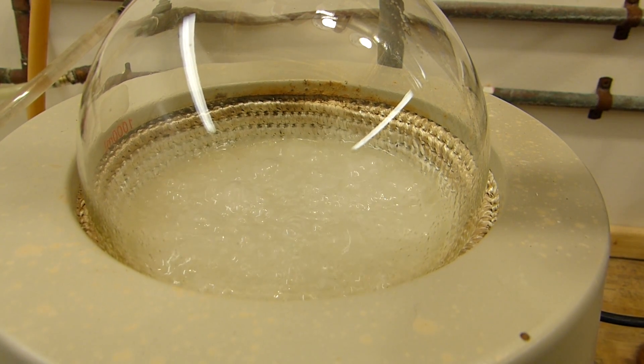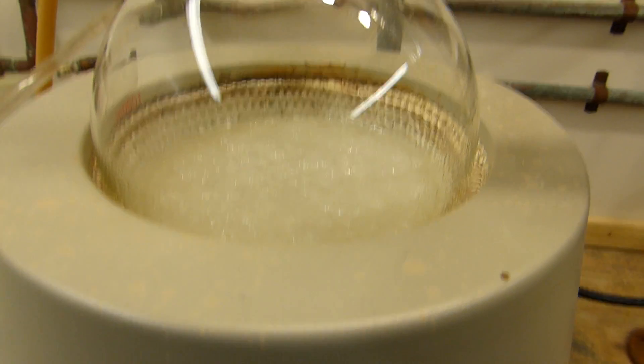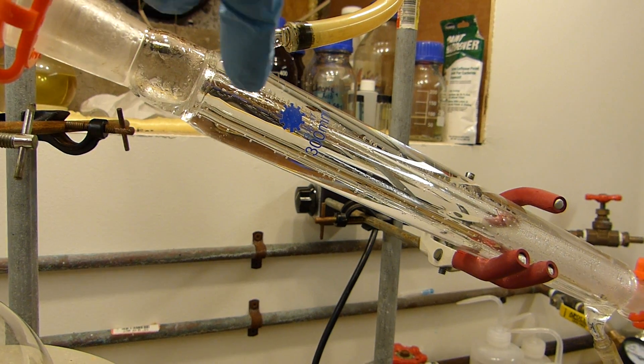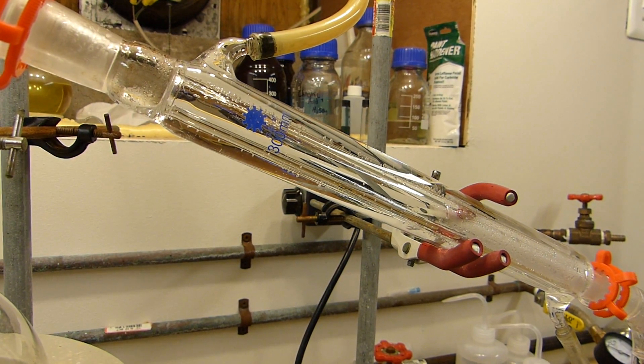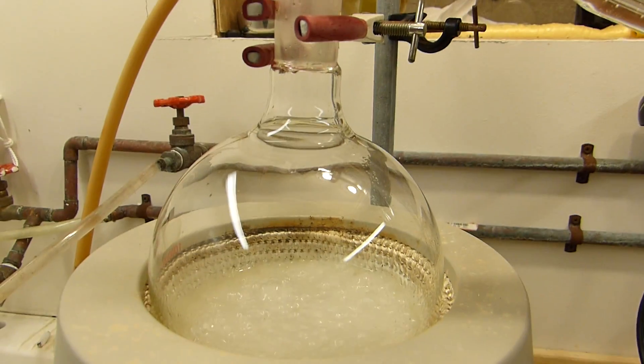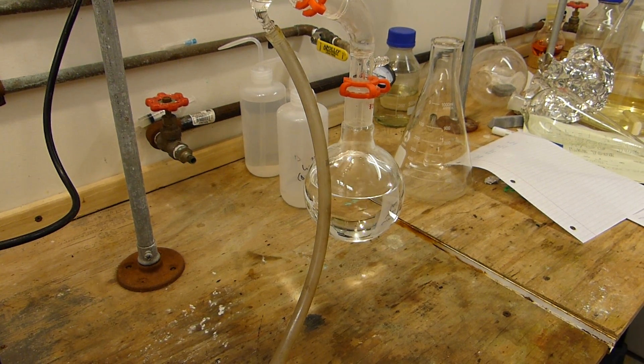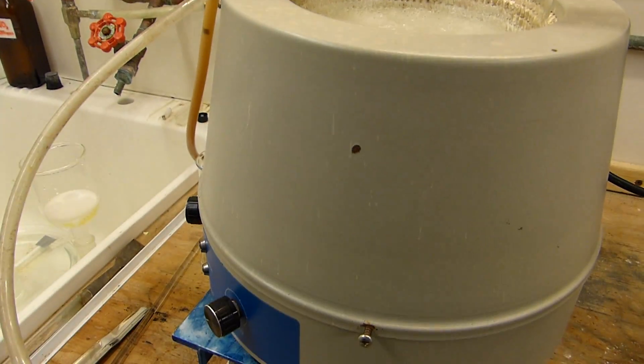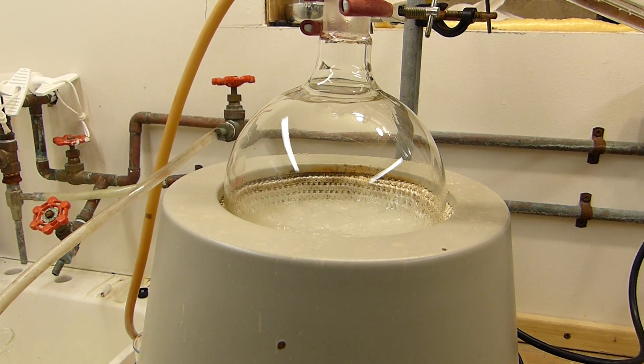And it looks like the distillation is wrapping up. That's getting awfully thick and I think it's going to be difficult to get out of the flask so I'm going to stop now. Besides, judging by the change in consistency of liquid condensing in the condenser—remember before it was making beads and now it's sort of a continuous sheet—that indicates that's probably methanol coming over rather than dichloromethane. The flask is pretty much full, about three quarters full, so I'm going to turn off the heat and lower the mantle, and once it cools sufficiently to stop distilling product we can proceed with processing the mixture.